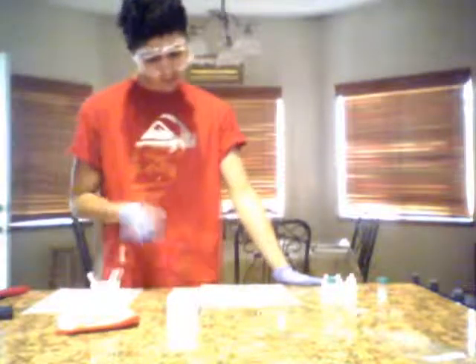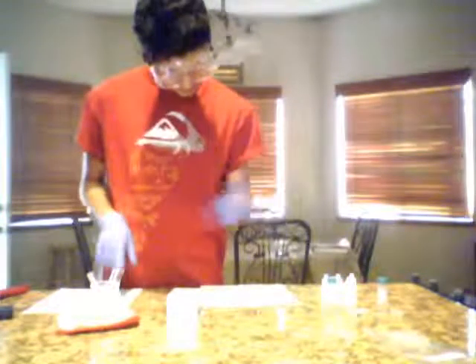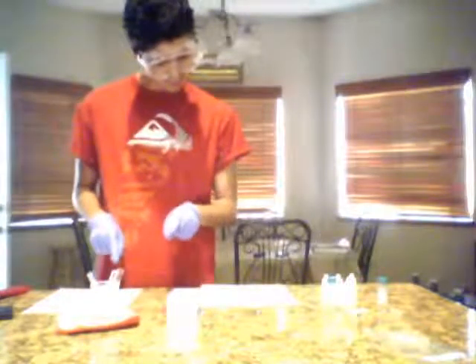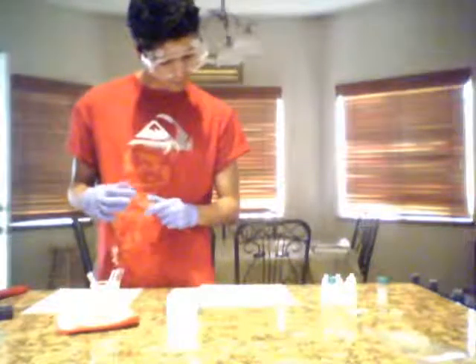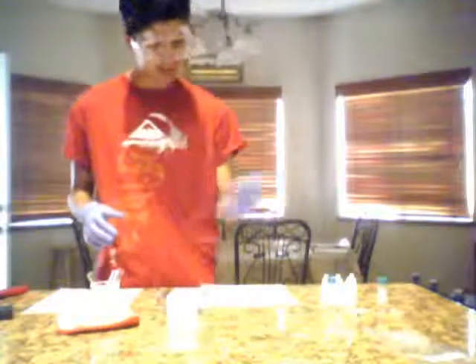Now next we're going to transfer the 3 tests. Actually, what we're going to do first is it says to use the clamp on the test tube one at a time from the hot bath water, suck up into an empty pipette, then drop 20 drops of water from the pipette into each test tube. Agitate and then replace the test tubes in the test stand.